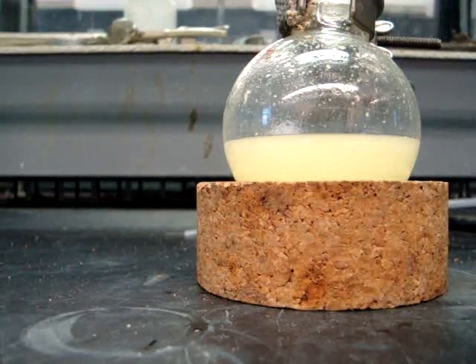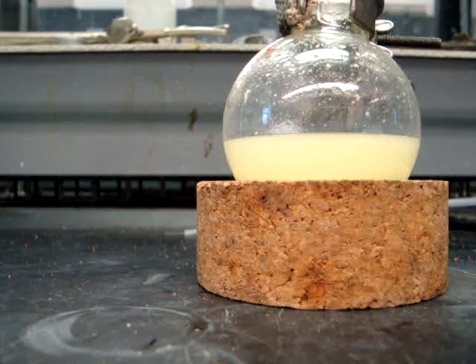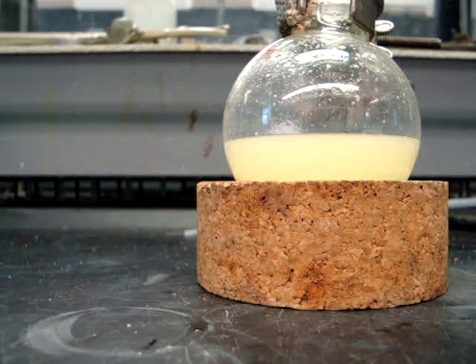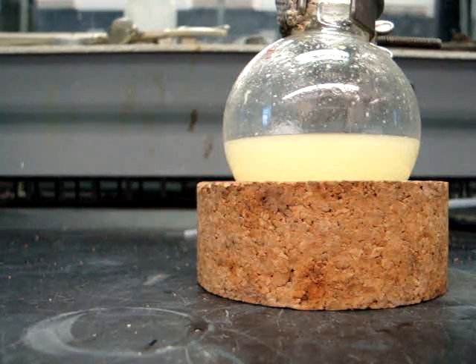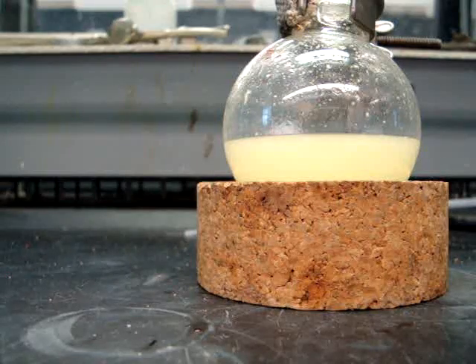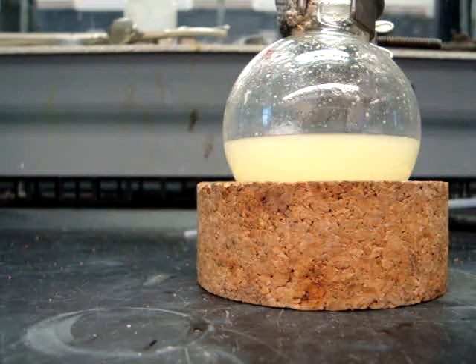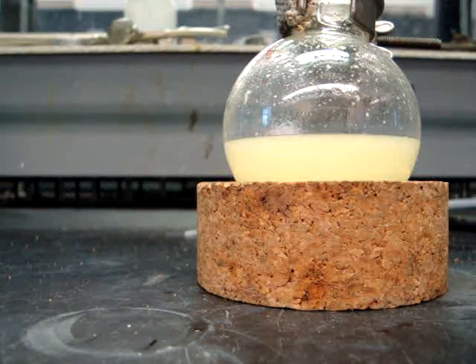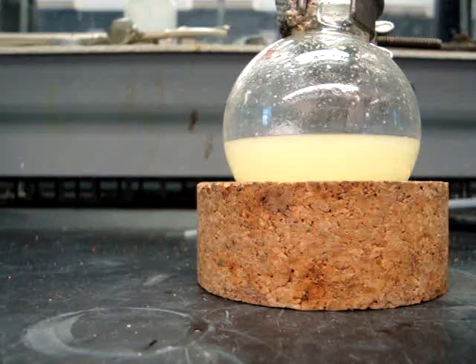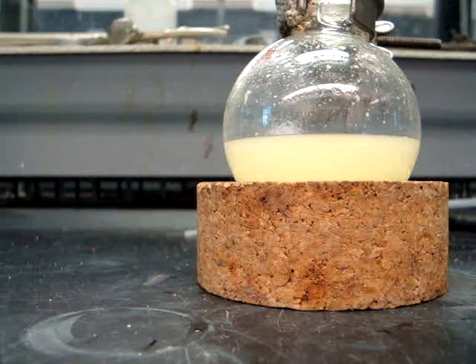After 30 minutes have passed, you will then filter the solid using a Büchner funnel. Wash the crystals three times, each with five milliliters of cold water. Refer back to the vacuum filtration video if you have any problems regarding this procedure.